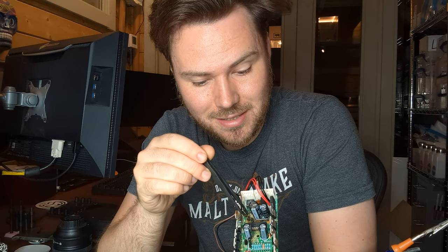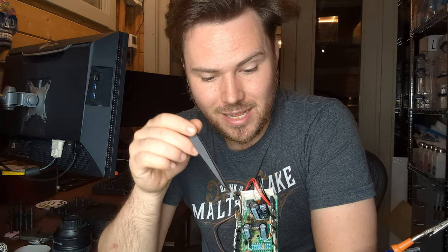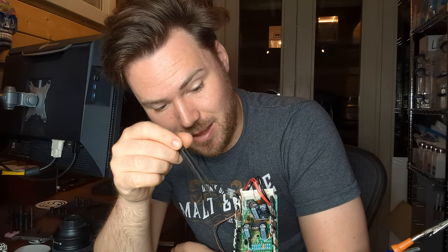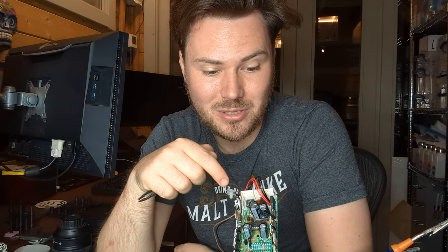And certainly this thing here is damaged. It looks like a transistor. It's got three legs and it's kind of the correct shape for what I think is an NPN or a PNP transistor. And hopefully that means that it can just be taken out and replaced. And if that's the case, it might just work with that. The difficulty is knowing what the part is. I'm going to see if I can get in with some bright light and take a photo of the part. And hopefully that'll tell me exactly what this is, so I can take it out, replace it, and see if it works.